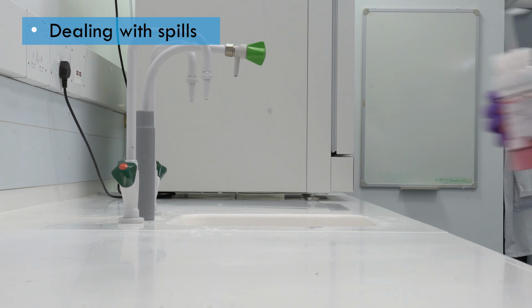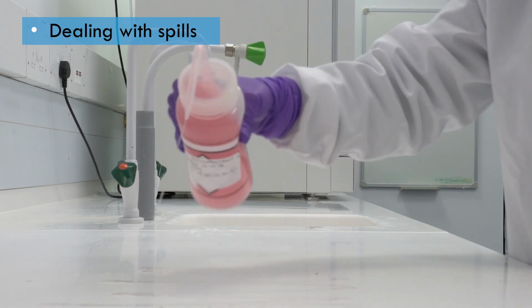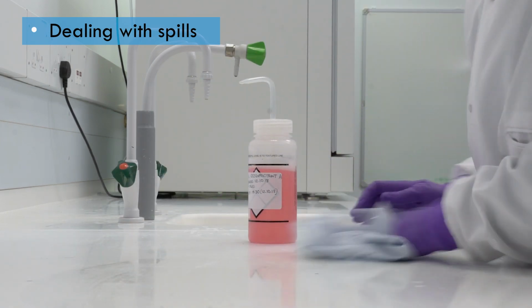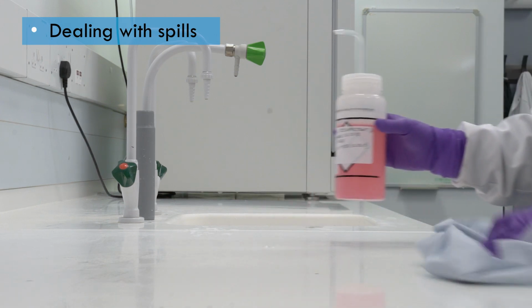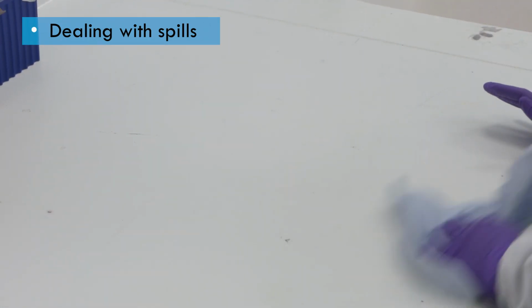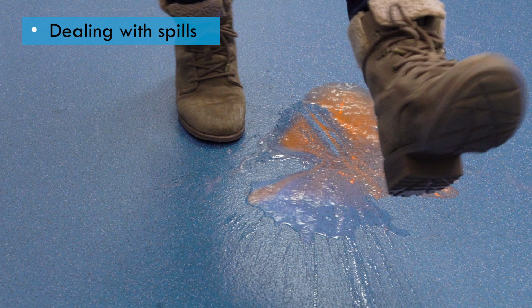The spill area should then be decontaminated with an appropriate disinfectant, remembering the basic rules. It should be within its shelf life, of the correct concentration, and left on the surface for the correct contact time without drying out. After disinfection, the surface must be dried before resuming work. This is particularly important on floors to avoid slipping on a wet surface.